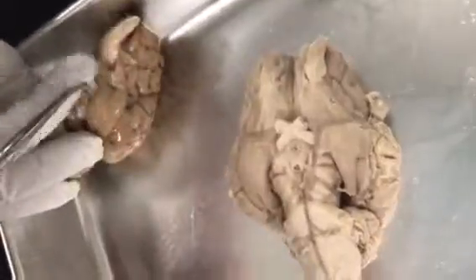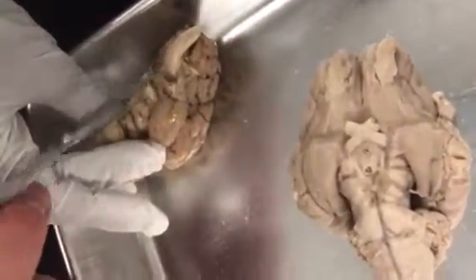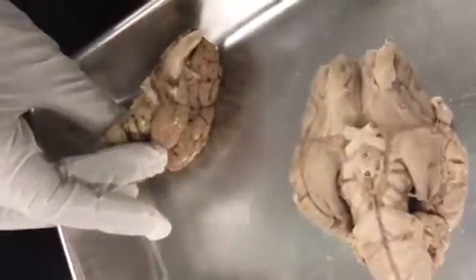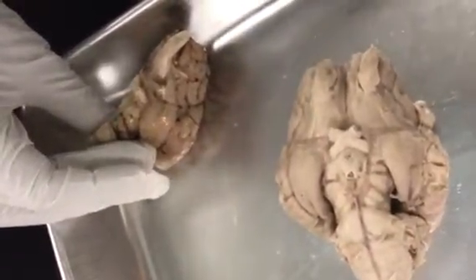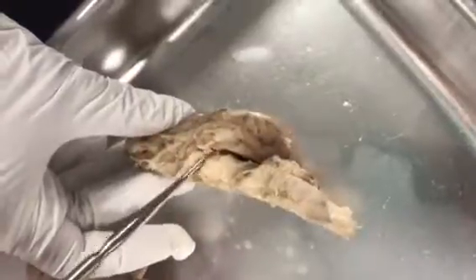In fact, if we look at this here, we can kind of see the track coming back. There we go. Right there. So here's the chiasm again. So here's the track coming back, and the nerve broke off. But it would be there. It would be going up. This one, I can't see the nerve there. Can we see the nerve on there? Sometimes you can. Sometimes you see the track, optic tract.